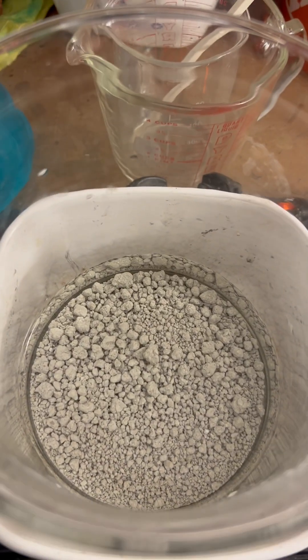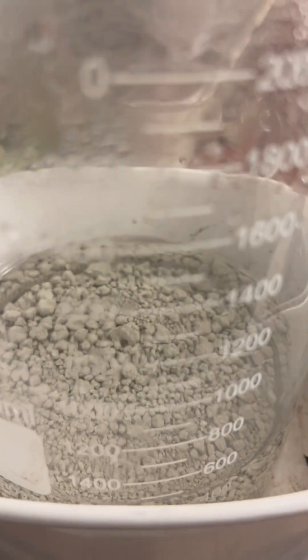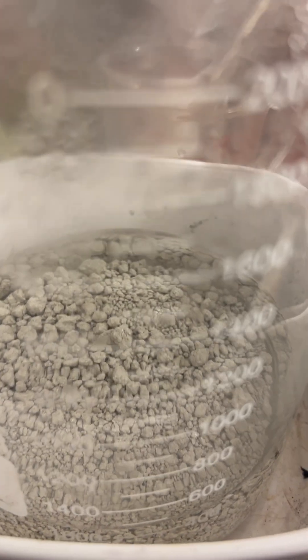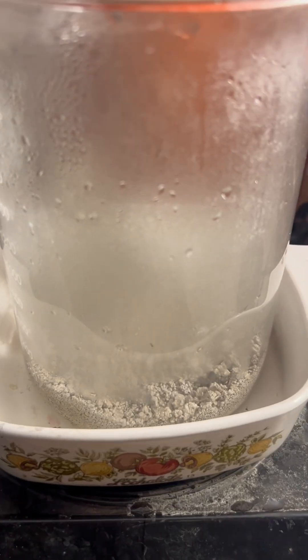This is the silver after five rinses. I will start to process that soon. One more rinse, we're gonna call it quits, and then we'll start drying it. Alright, so we're gonna dry this out.